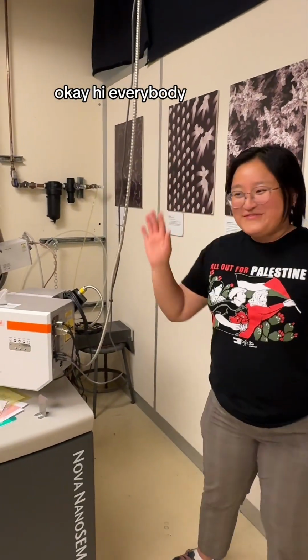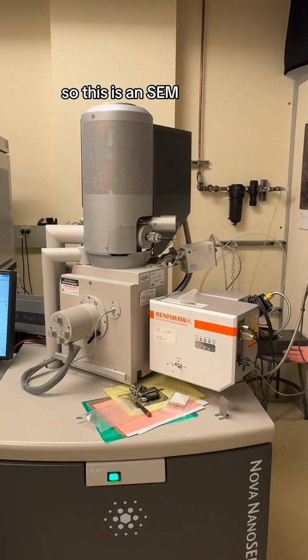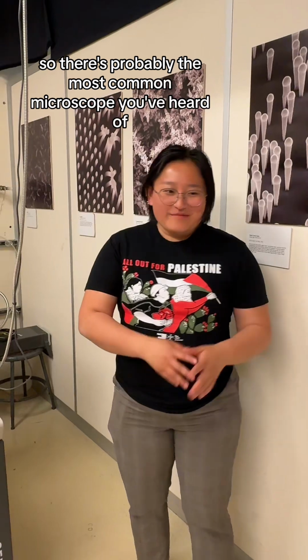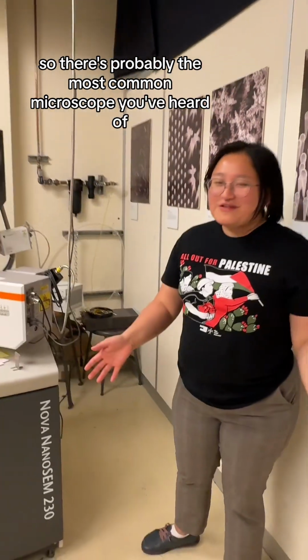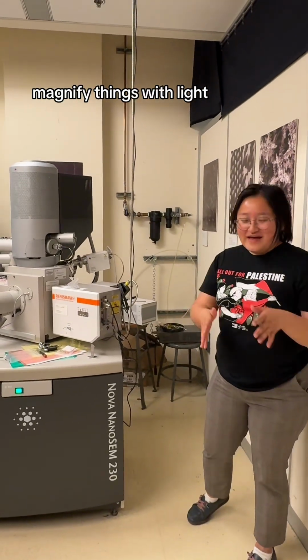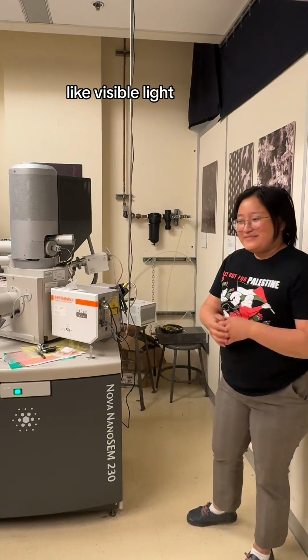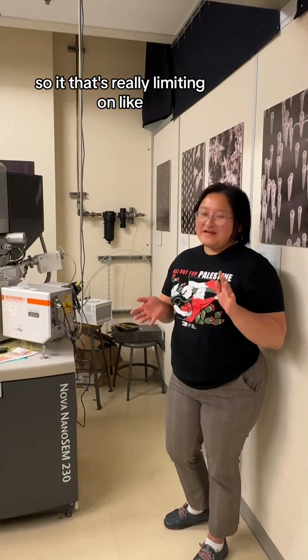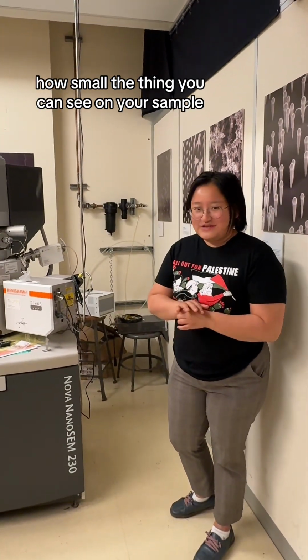Okay, hi everybody. So this is an SEM, which stands for scanning electron microscope. The most common microscope you've probably heard of is an optical microscope, where you're looking at magnified things with light, like visible light. But visible light has a pretty large wavelength, so that's really limiting on how small of a thing you can see on your sample.